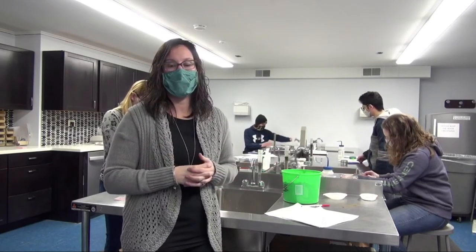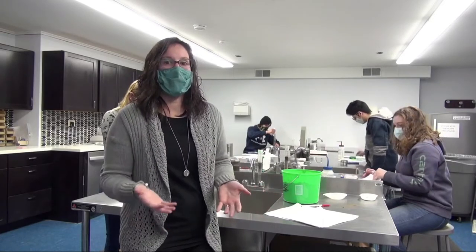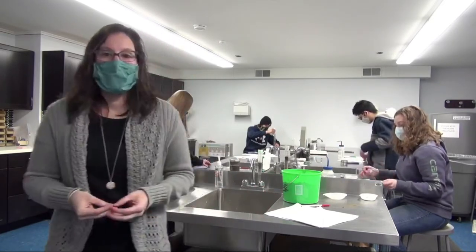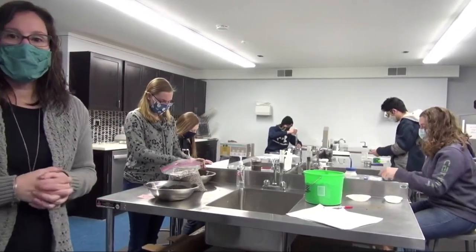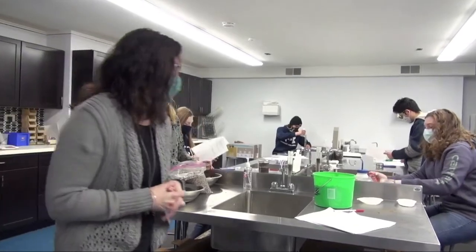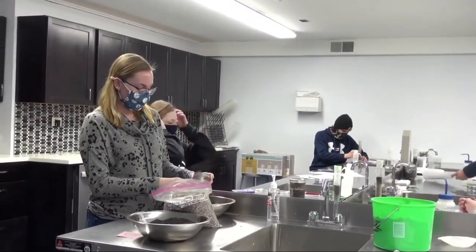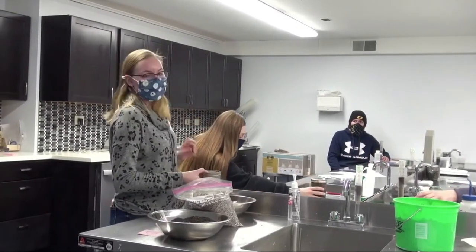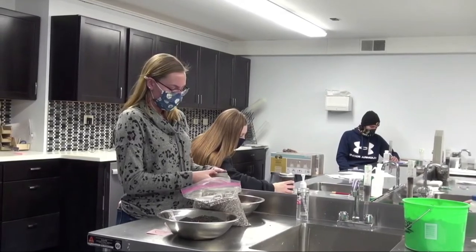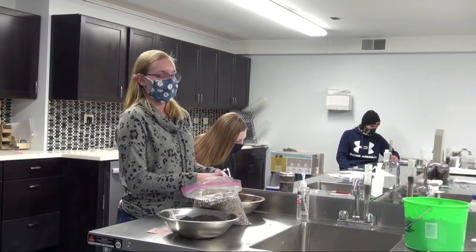All right, so I'm going to pass it over to Gracie here, and she's going to talk a little bit more about bulk density and porosity. Hi, I'm Gracie Wagner. I'm from Milford, Illinois. I'm filling my dish here to measure bulk density at the scales over there. We use bulk density to measure the amount of solid particles within a given amount of soil. And we can use that to also measure porosity within the soil.